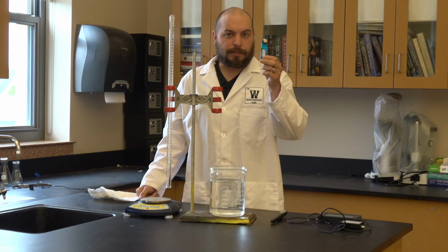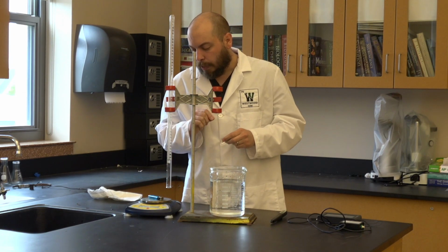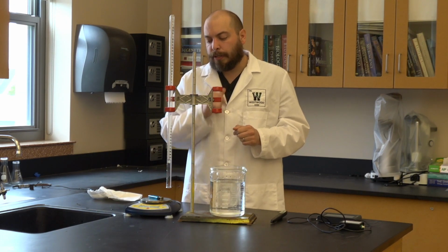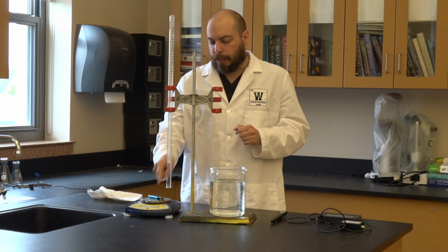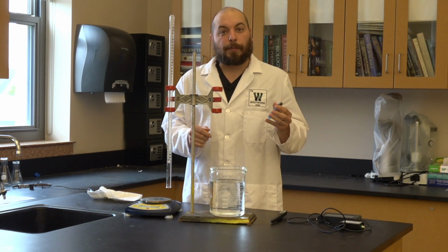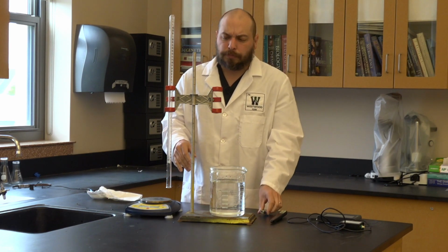I'm now going to take this lighter, and I'm going to place it on a zeroed balance. That's my initial value for mass. So I've got an initial value for mass now, and with it I'm going to start the experiment. Again, keep in mind how wet the lighter was when you took that mass.